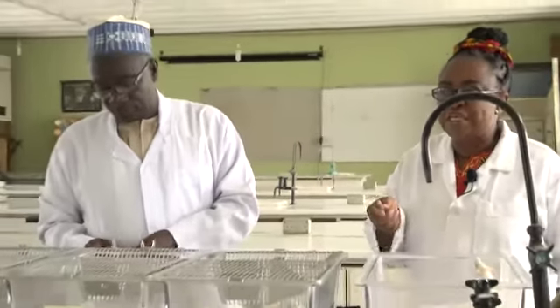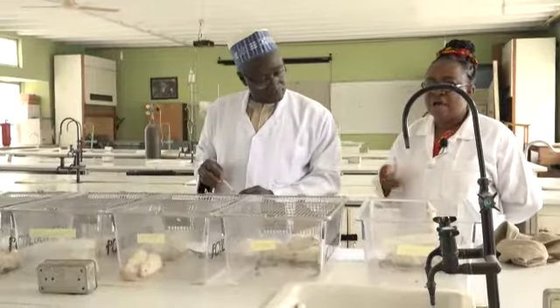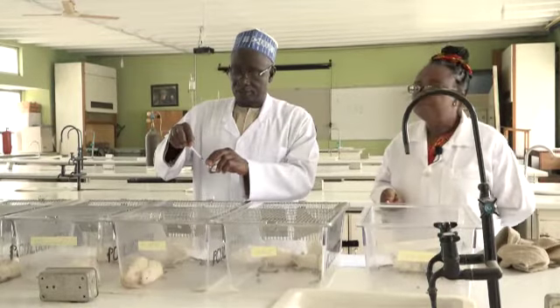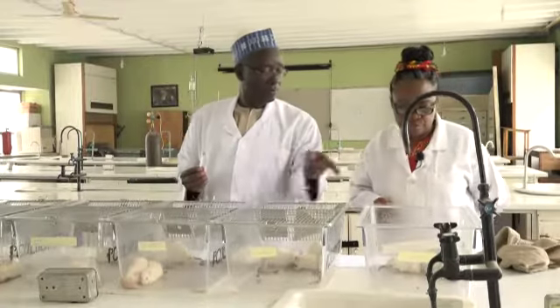And if you watch the technologist, he's using a completely new syringe. You have to use a different syringe for normal saline, yet another one for the organophosphate, and yet a different one for the antidote. You cannot keep using the same syringe across board.